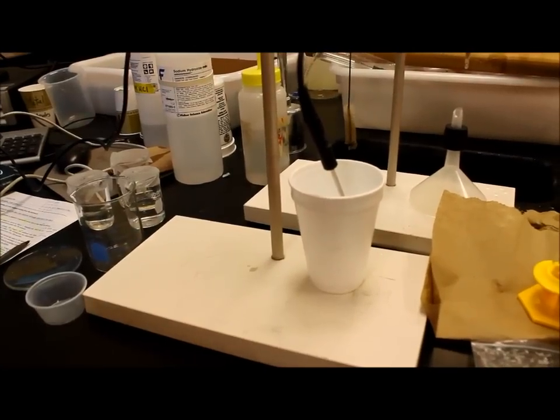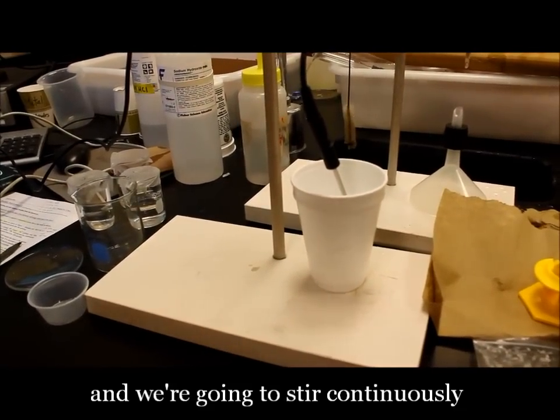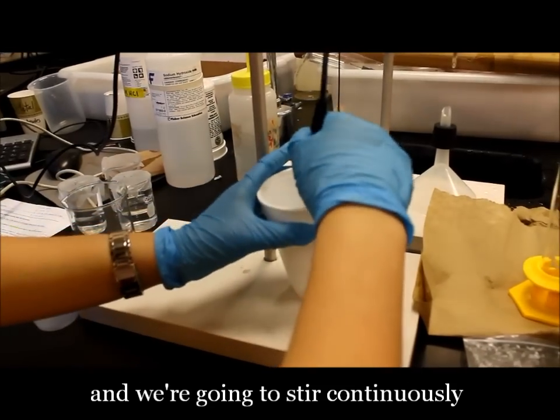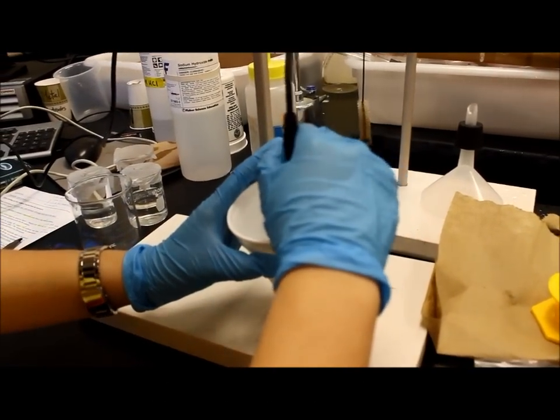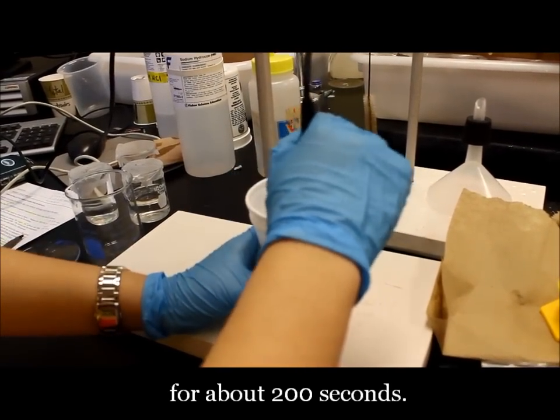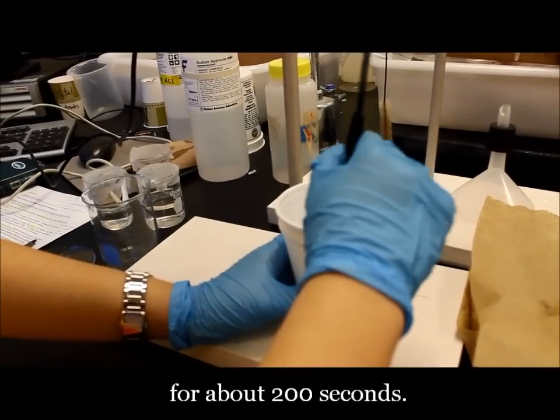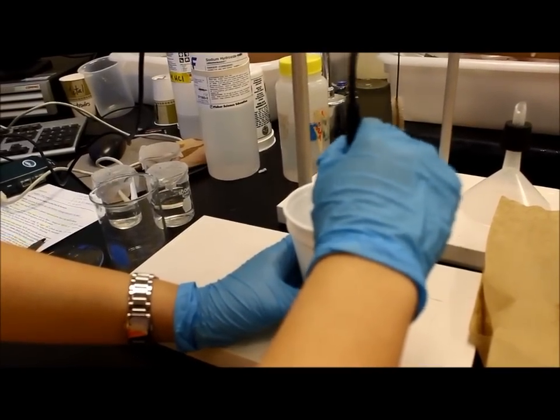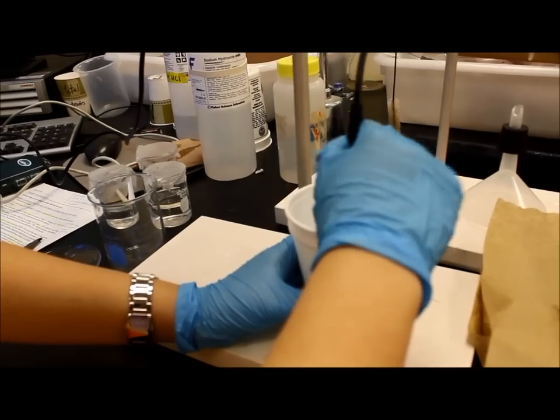And then we're going to stir continuously for about 200 seconds.